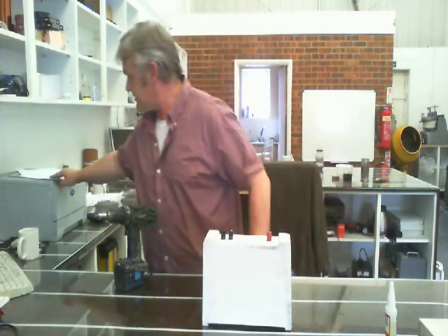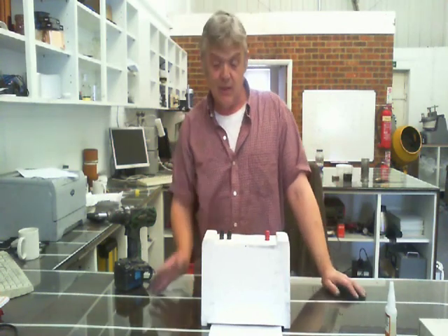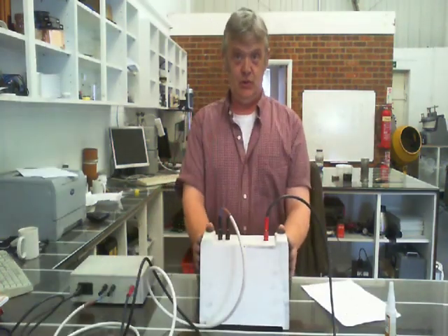Now you notice there's a tiny gap under there, and I've left that gap so that when I get a piece of paper, the paper will slide under the unit so I can flash it and slide the thing up and down. So all we need now are some cables to connect these things. So that's the flash unit put together.